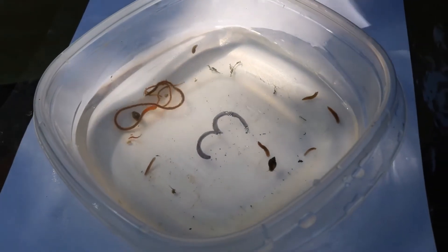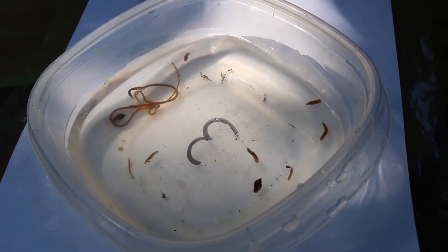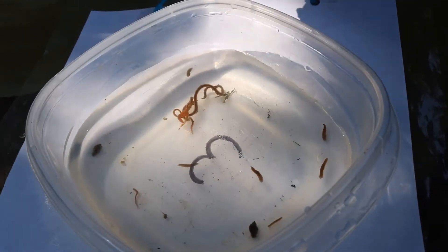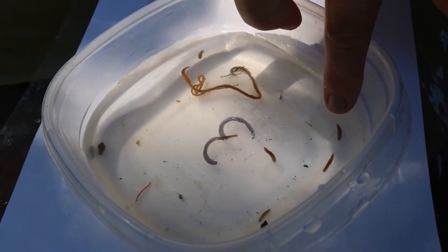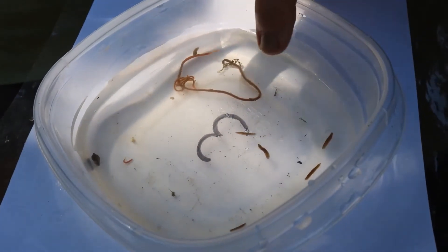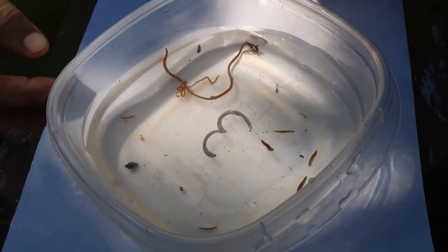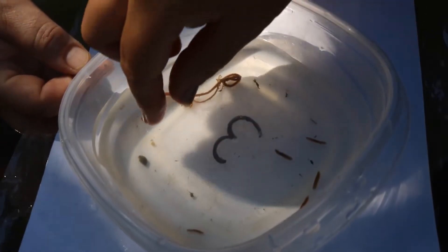The container labeled 3 holds taxa group 3 — animals that are very tolerant to pollution. We have aquatic worms. These are not the ones you would find in soil; they look a lot like garden worms but live in water. We also see planaria worms here. If you look closely, you can see a little arrow-shaped head and tiny eye spots — not that they have vision, but they're sensitive to light and dark. They have a little feeding tube on their belly, kind of like a small elephant's trunk, and they eat a lot of the dead material in the water.